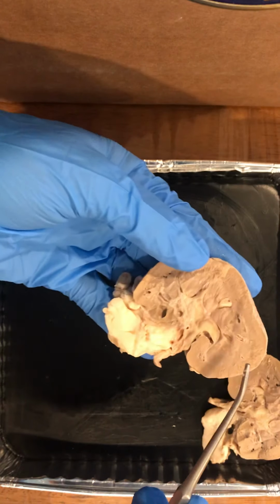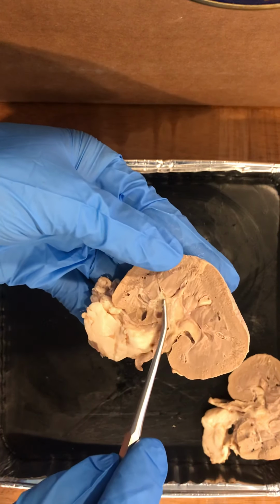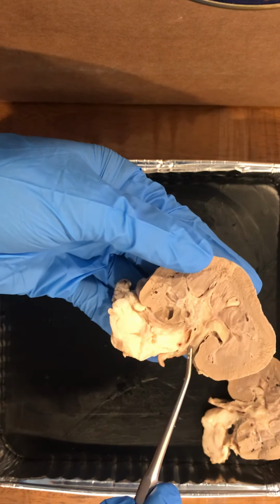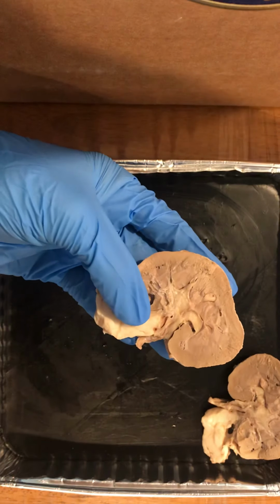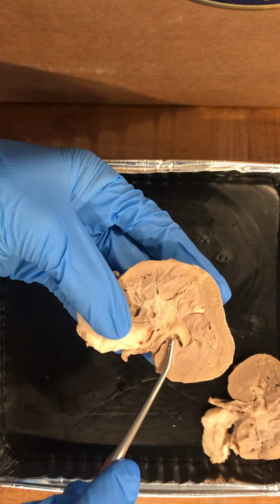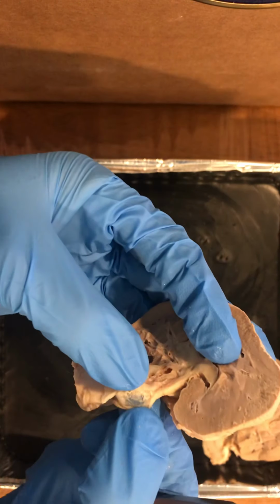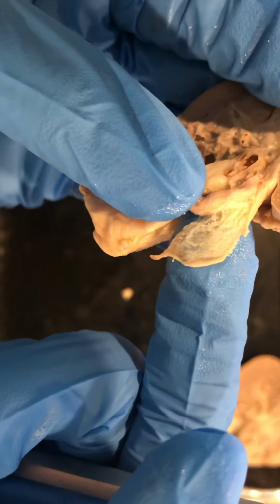Each renal papilla discharges the urine into the minor calyx, which are these structures here, and from the minor calyx they enter the major calyx, where they enter the renal pelvis, which is here, and then go to the ureter. The renal pelvis is formed by a wall of thick fibrous tissue, and it is an expansion of the ureter. I opened the ureter as the lab asked and was able to see the ridges in there, if you can see on there.